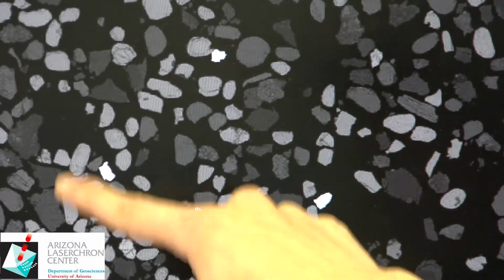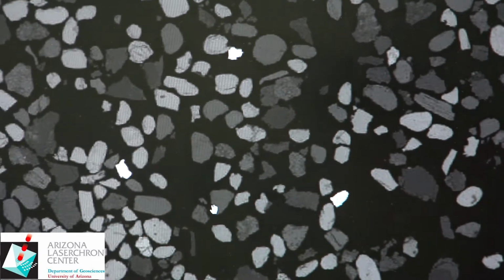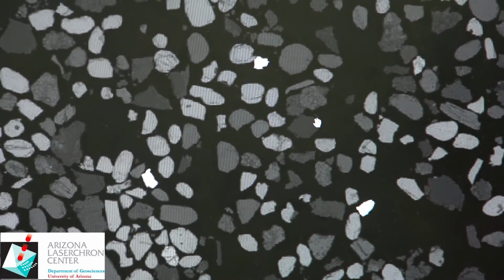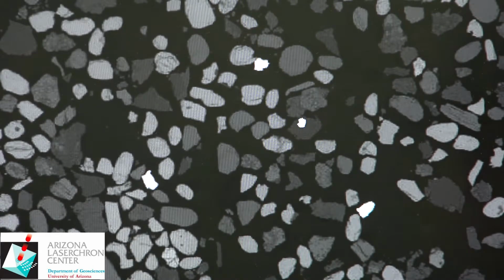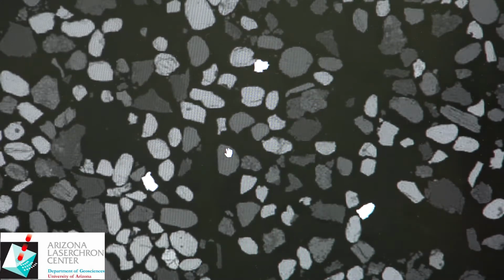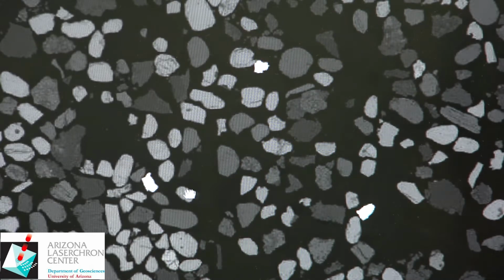So looking within this area here, we see several different shades of gray. We see a very, very dark, almost extinct looking grain right here, a more mild, lighter gray, but still rather dark, and then we get into the light grays of the zircons, and then you have these really bright white pieces, which are most likely some barite, which is the most common mineral that we see inside of detrital pours that have a brighter response than zircon itself.